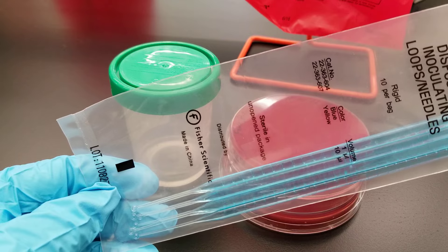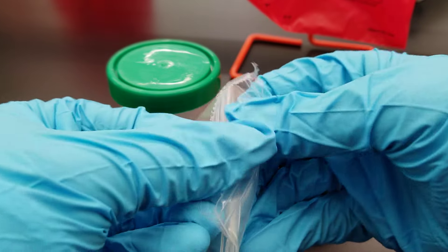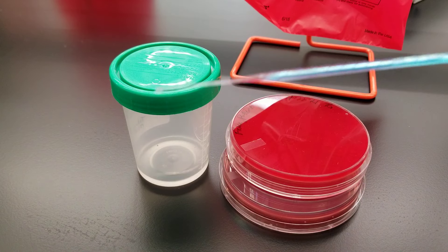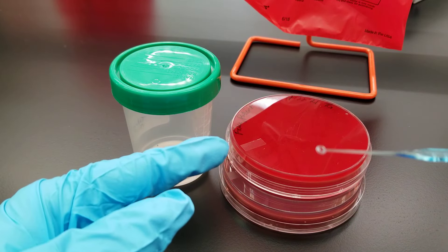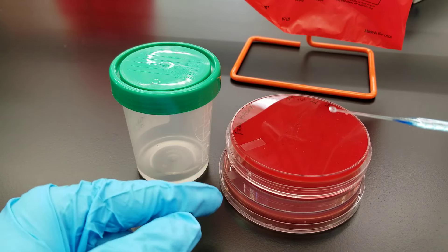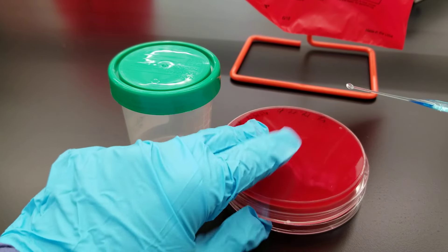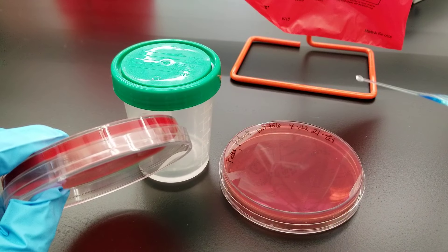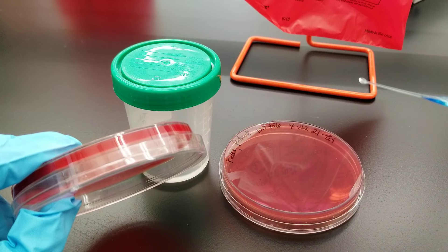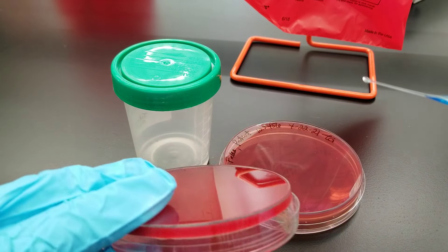That is how a colony forming unit is calculated. We've got the blood agar plate because that should grow everybody that could possibly be present in a urine — it's basically like a nutrient agar. And then we have the MacConkey agar plate, which is to grow those GNRs. Most of the time, you'll find that urinary tract infections are from the GNRs, from the Enterobacteriaceae family, but that is not always the case.